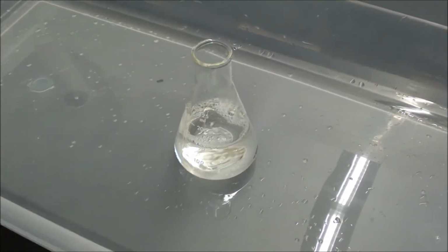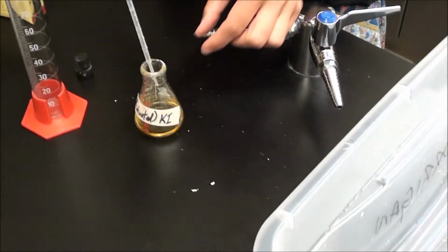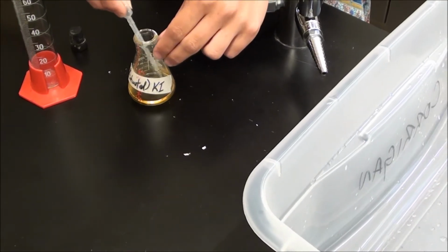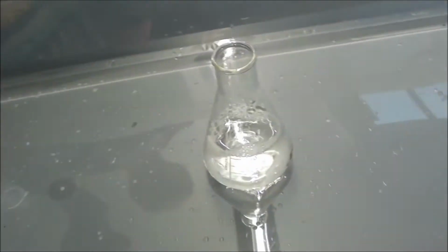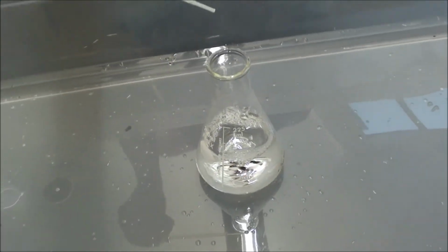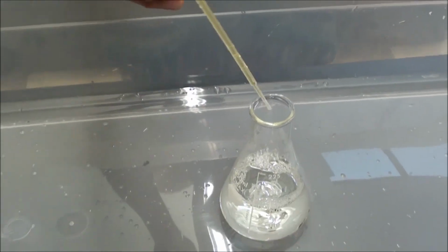Okay, now put a good amount of catalyst in. Wait, okay. Okay, ready? Are you ready? I mean, no. Sorry. Not ready. Go.